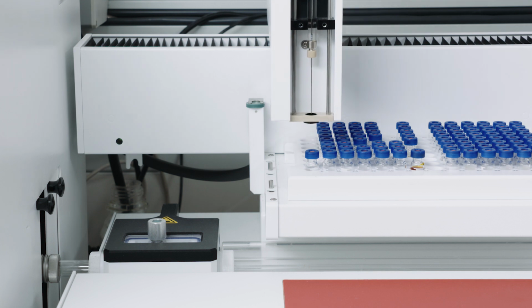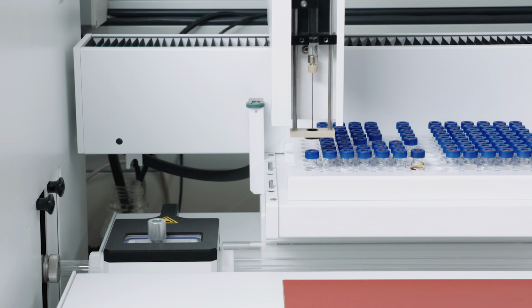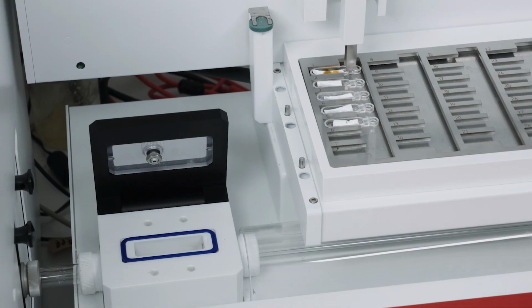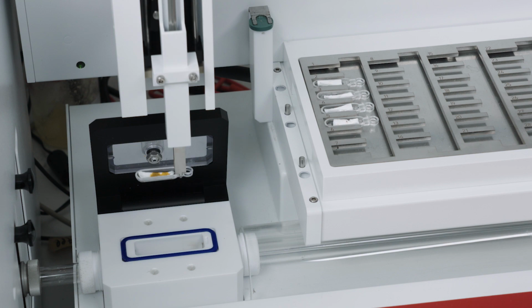The sequence entries are processed now automatically. The results are available when the measurement is finished. Highly viscous liquids can be dosed like solids. Therefore, they are weighed into sample boats. It is important to also add a quartz material to prevent a too vigorous reaction and a too fast evaporation process. Sample supply can happen manually or fully automatically.